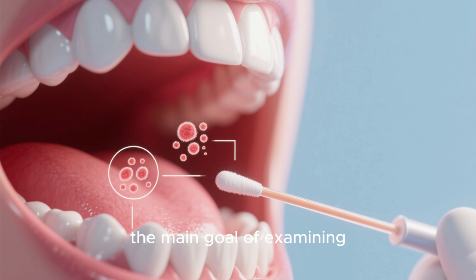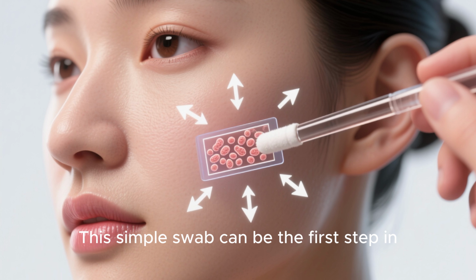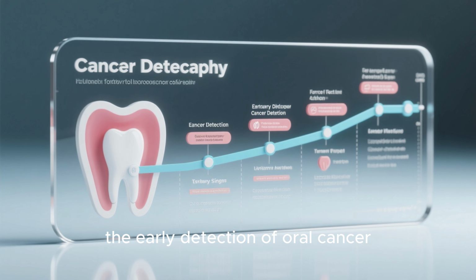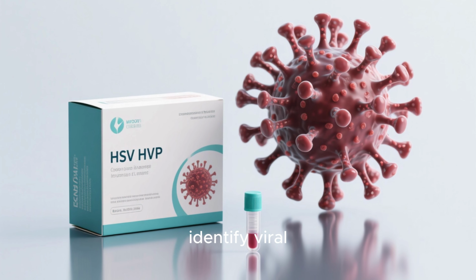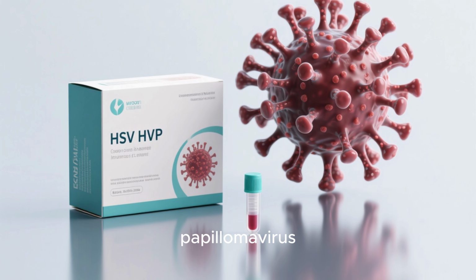So, what's the main goal of examining these cells? It's a non-invasive way to check the health of our oral tissues. This simple swab can be the first step in detecting some serious conditions. For example, it's used for the early detection of oral cancer, helping catch it before it becomes more dangerous. It can also identify viral infections, like HSV, the herpes simplex virus, or HPV, the human papillomavirus.